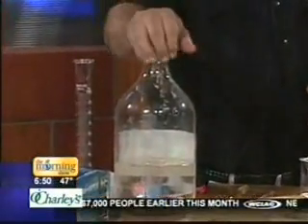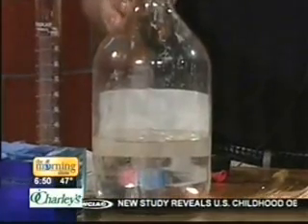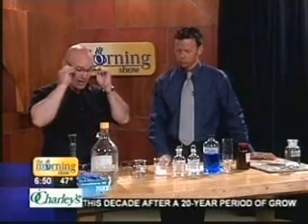Now, sulfuric acid turns out to be a really important acid in the industry. You can pretty much tell what the industrial strength of a nation is by how much sulfuric acid they're producing in a year, because it's used for a lot of industrial processes, and we'll show that here in a second. Now, sulfuric acid is very hygroscopic, which means it likes to absorb water. Different acids have different properties, and that's one of sulfuric acid's, and I'm going to show that here.